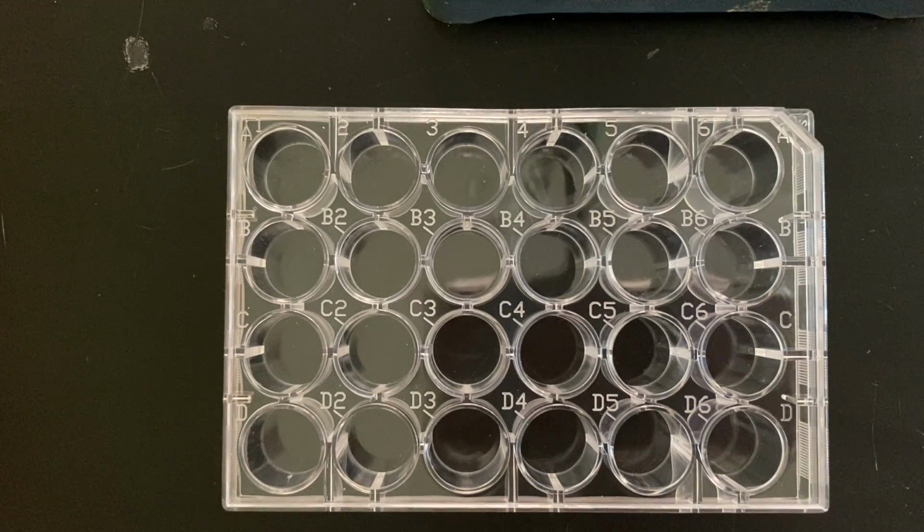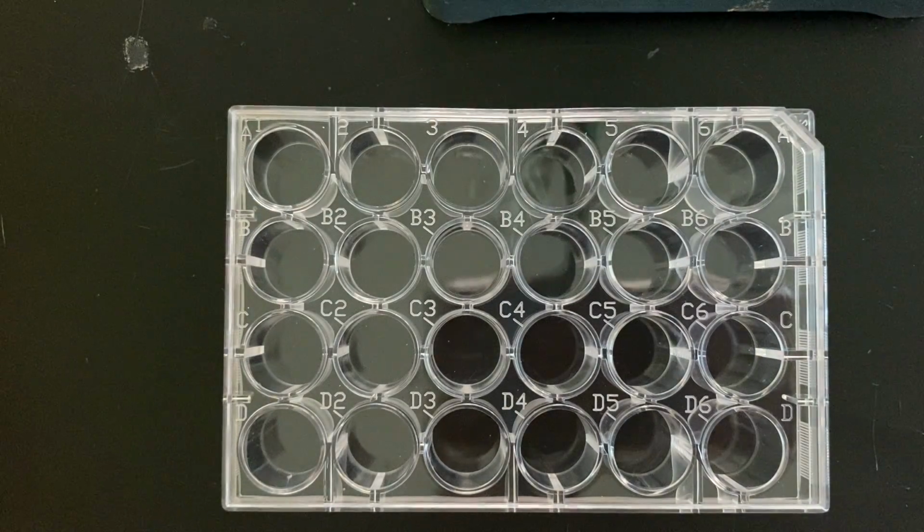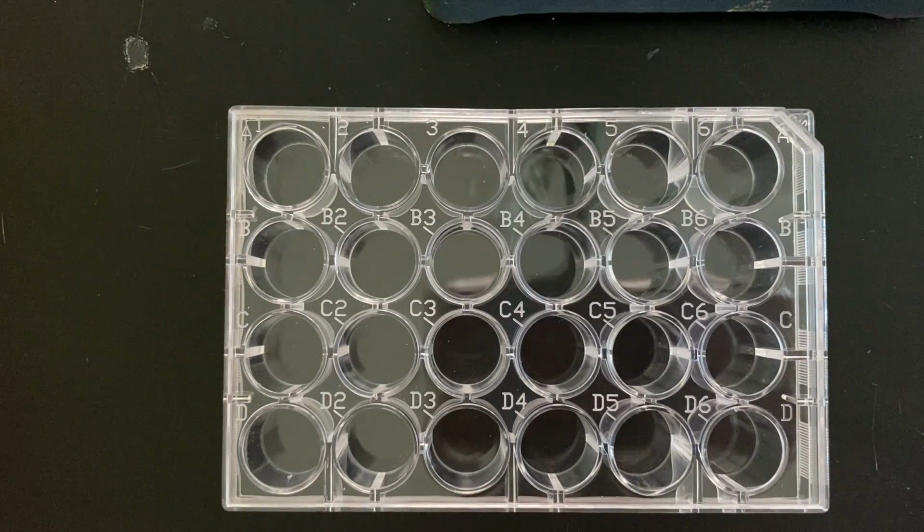So here is the data for part 2, where we are reacting solutions of various alkaline earth metals. So we're using magnesium chloride, calcium chloride, strontium chloride, and barium chloride, so the group of alkaline earth metals, with various testing solutions. You can see in your directions, there's sodium carbonate, there's sodium sulfate, and there's potassium iodate. So what we're looking for is how often does the chemical react.